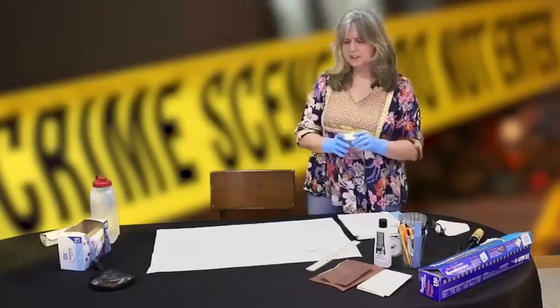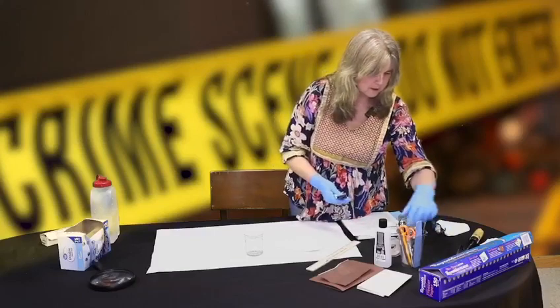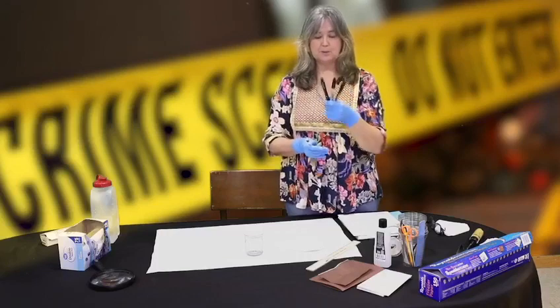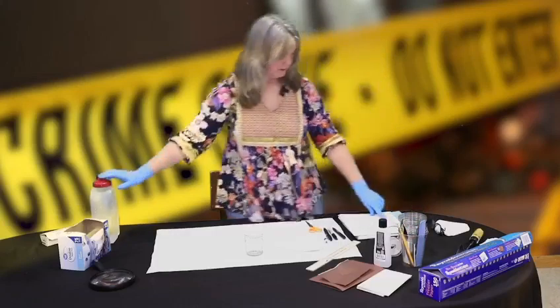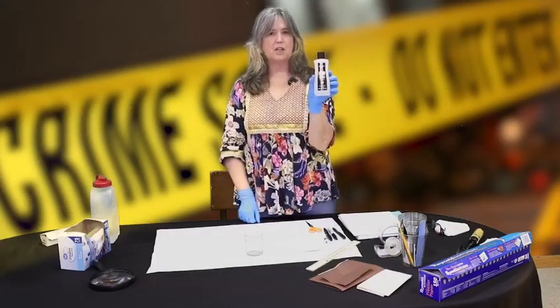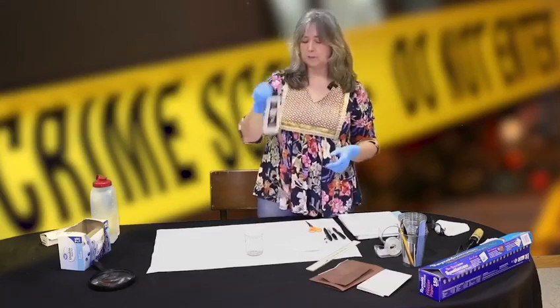You want three to four pens. I have four pens here — three black ones and one blue one. We're going to see if the ink in these three black pens is all the same. I need scissors, water, and acetone. Acetone is basically fingernail polish remover. You can buy it at the store — buy the cheapest you can. The fingernail polish remover sometimes will be pink or blue, so try to get the clear kind; it's usually a little bit cheaper.